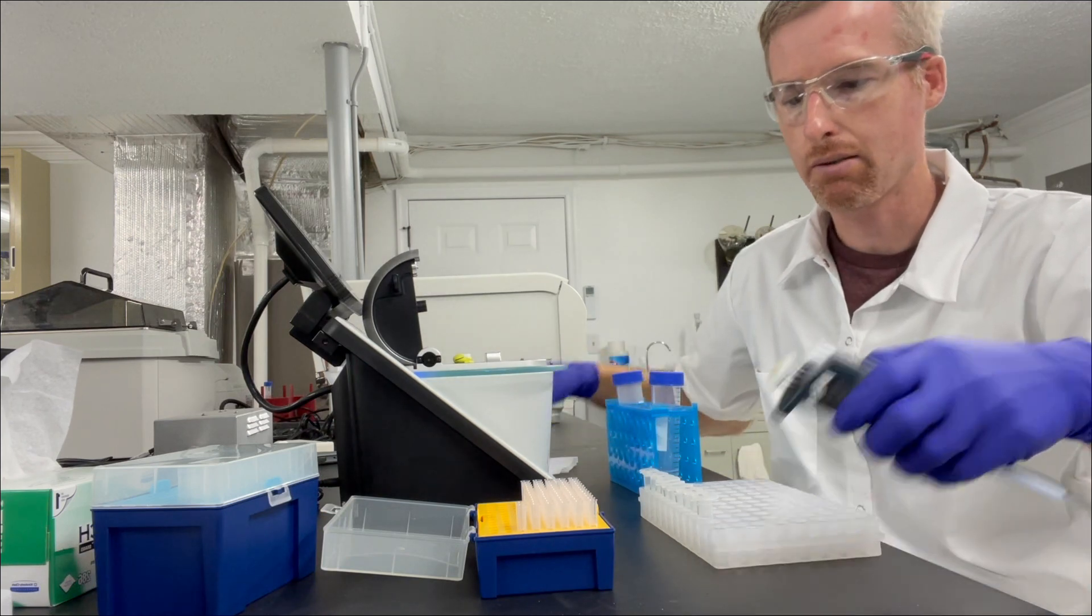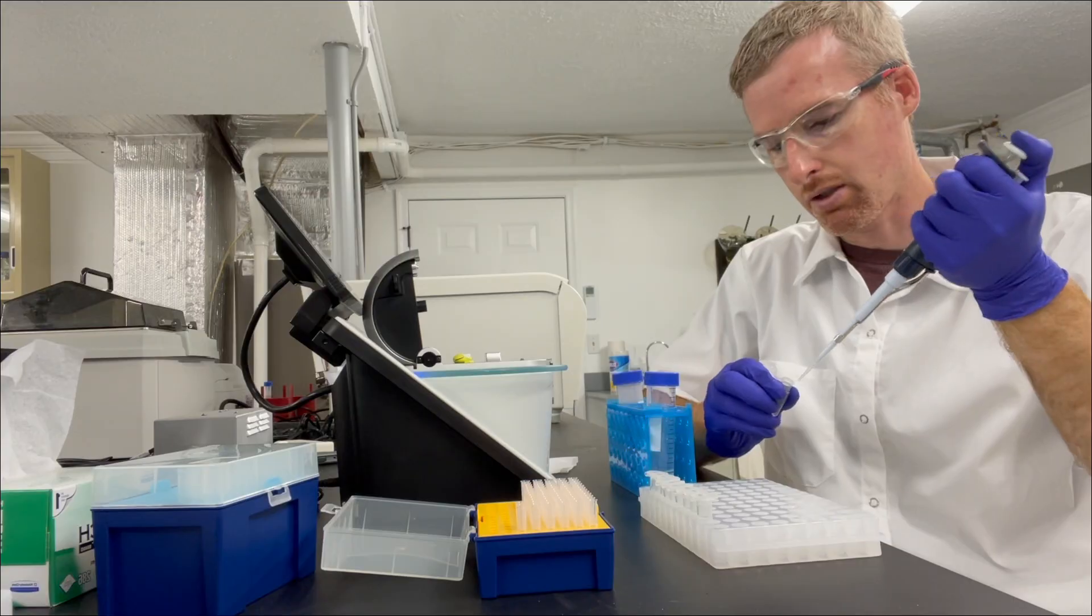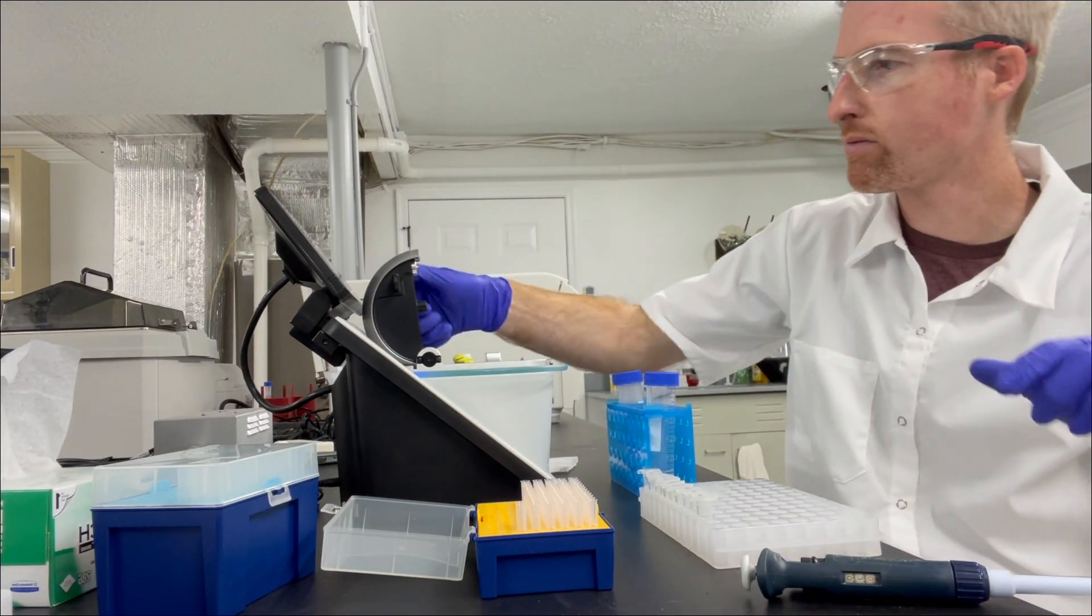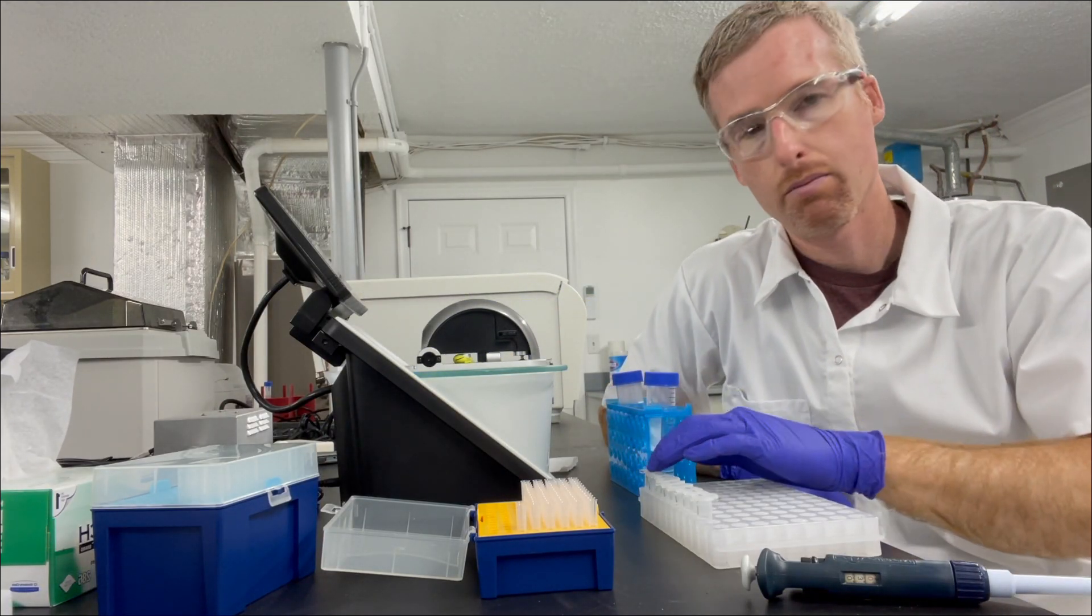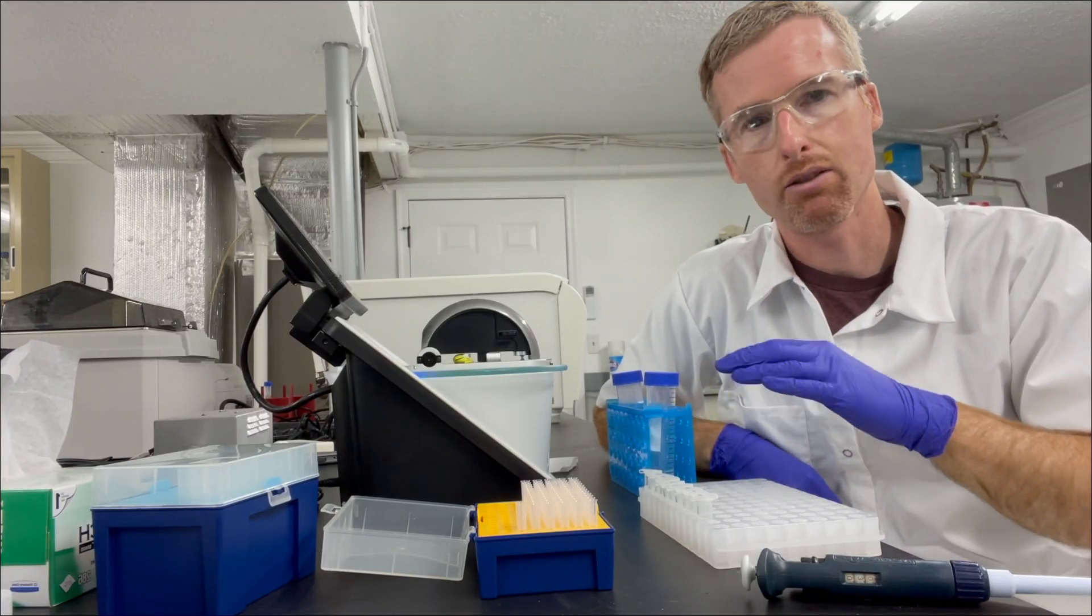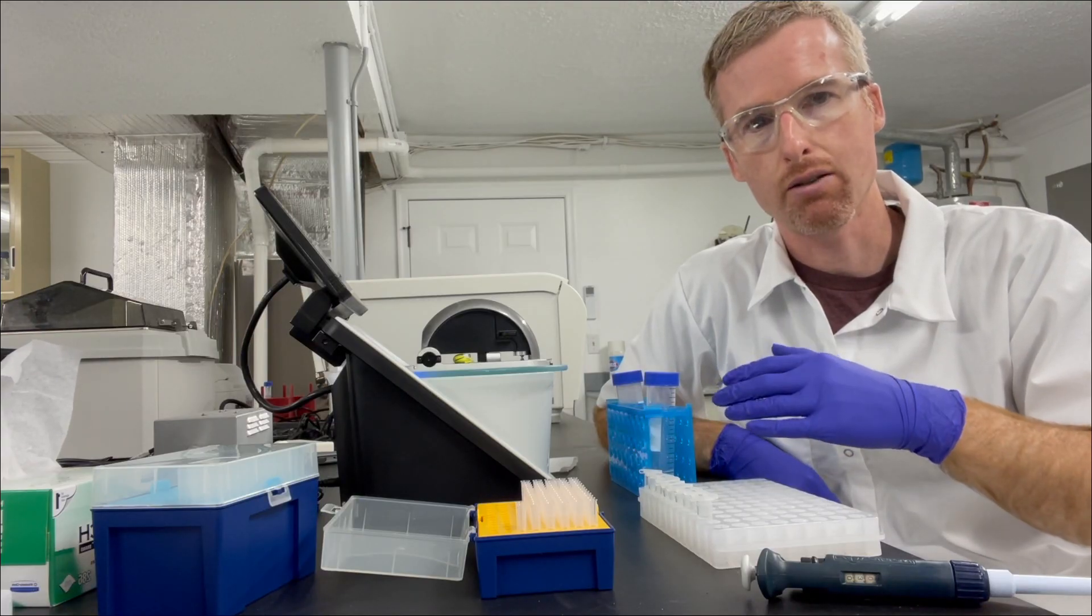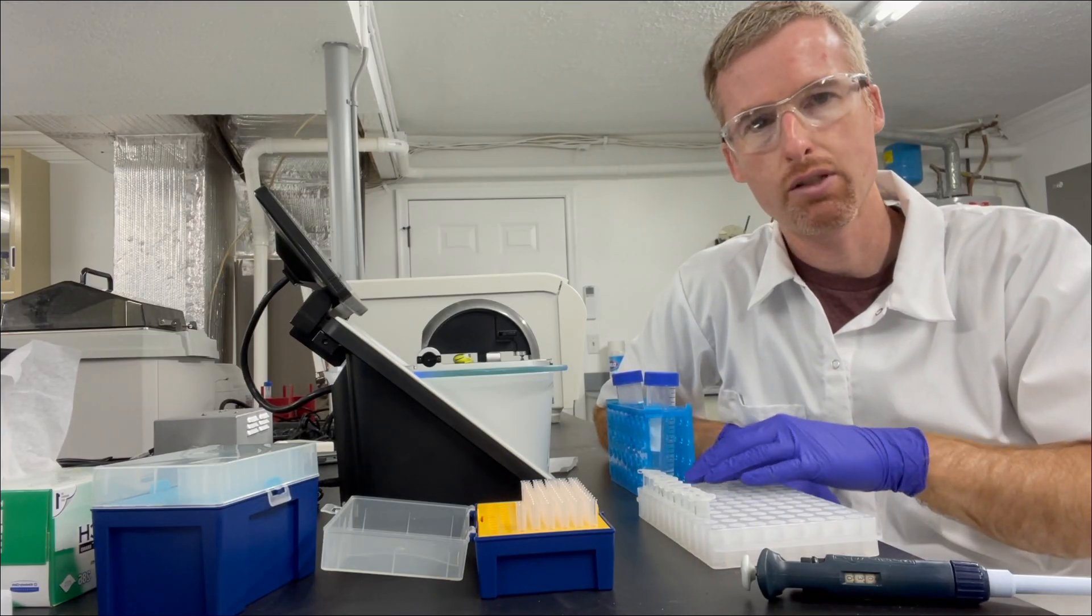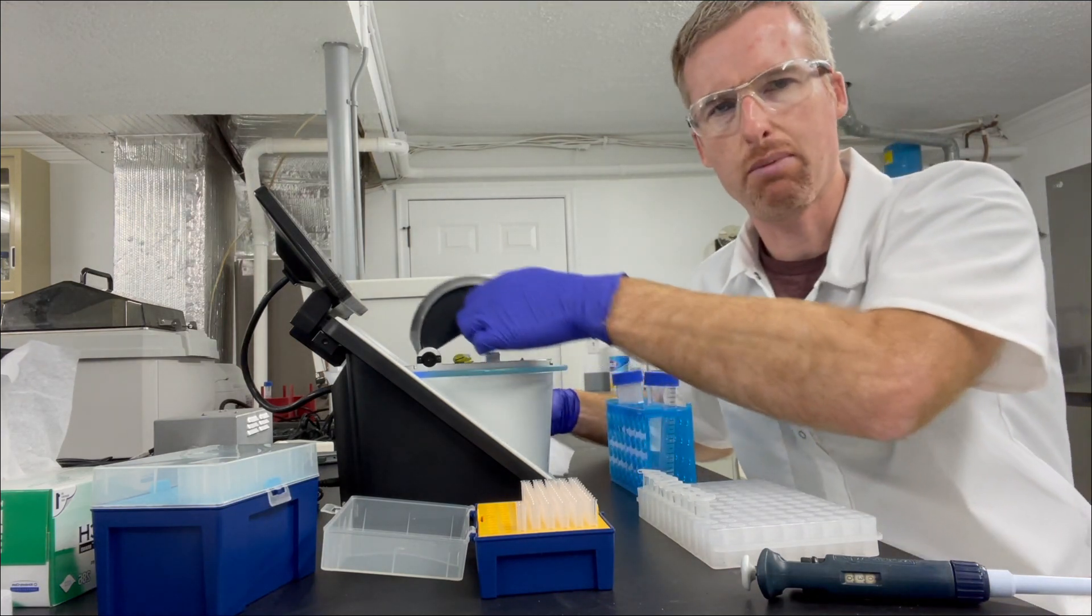And once it's blanked, I'm going to get one of my fractions and measure the protein concentration. And keep in mind that the first fractions are going to have a little bit less imidazole in them because of the buffer that came in from the nickel agarose mixing with the elution buffer. So the concentration of protein in those first two or three fractions is actually going to be underestimated, but not by too much.